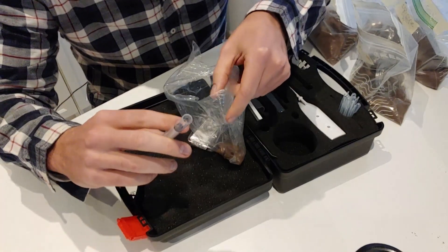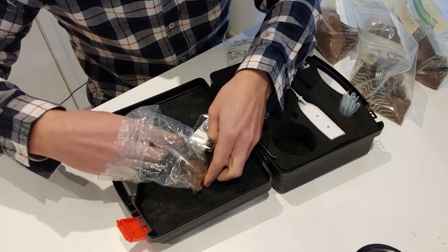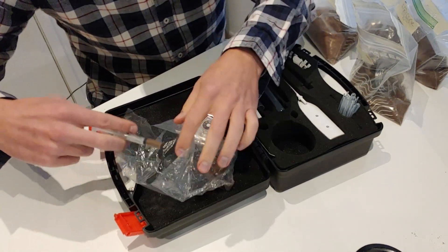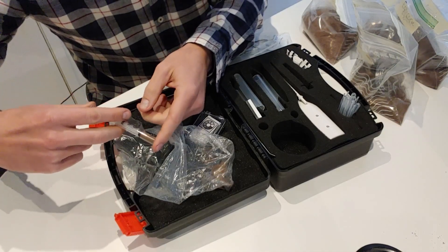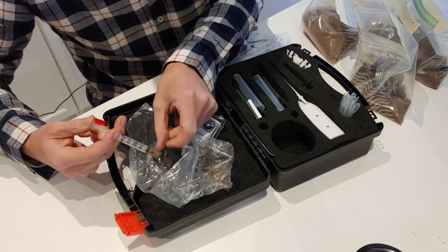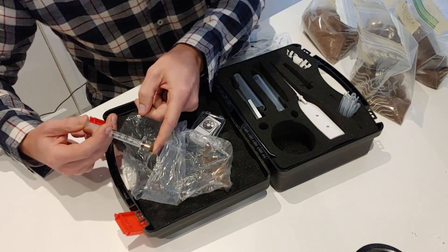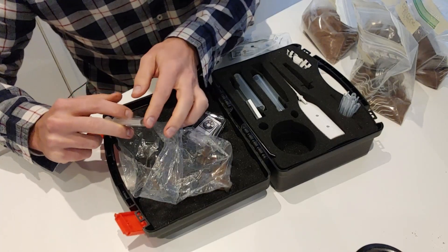Next, I'm going to use the syringe to gather enough soil to fill it up, then compress it all the way down to just a half — some will fall out the bottom. Get rid of any excess, and this is the amount that you need.